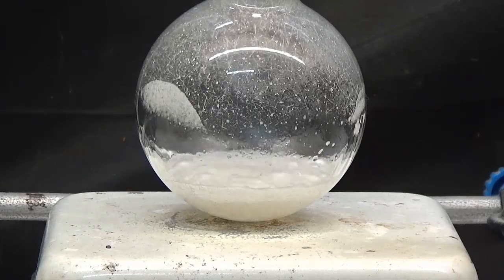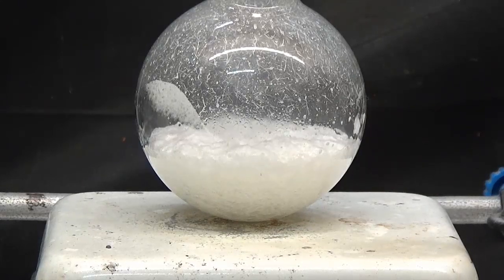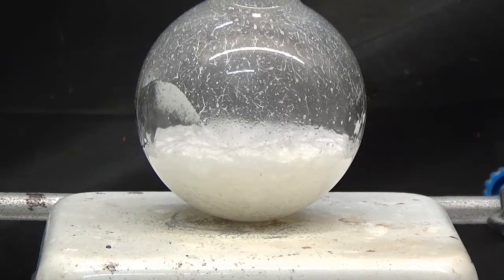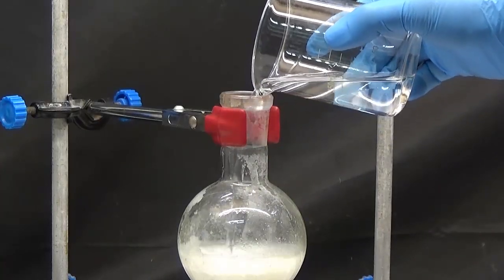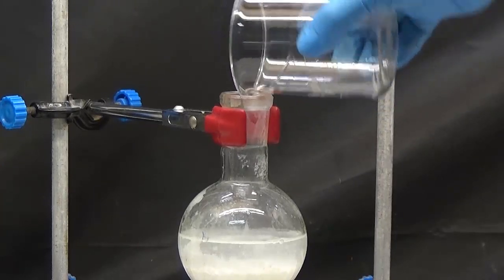Second, it forms a foam and immediately solidifies. Remove the heat and let it cool to room temperature. Add 100ml of water and disintegrate it with a glass rod.